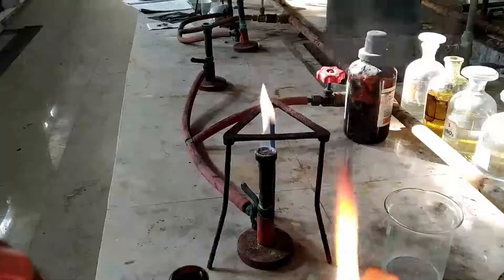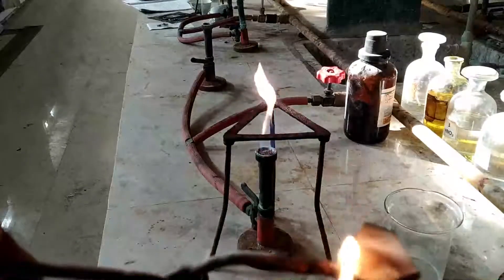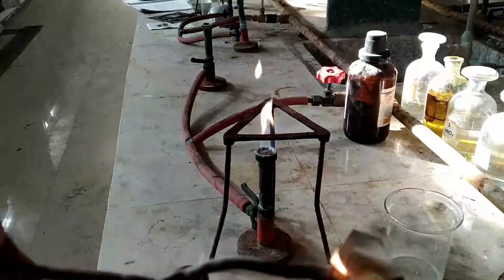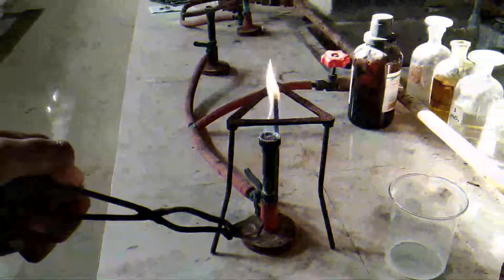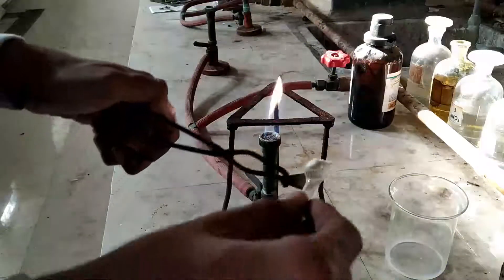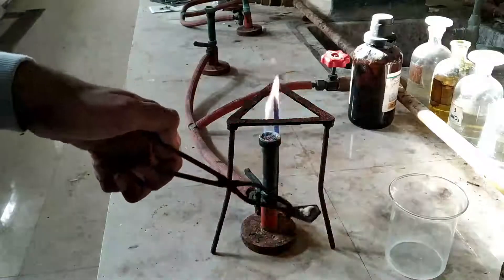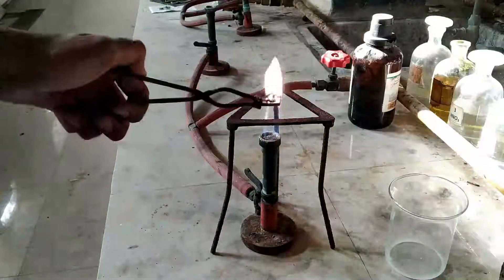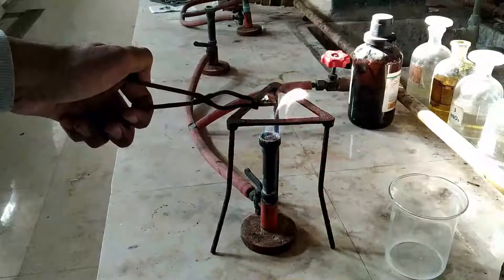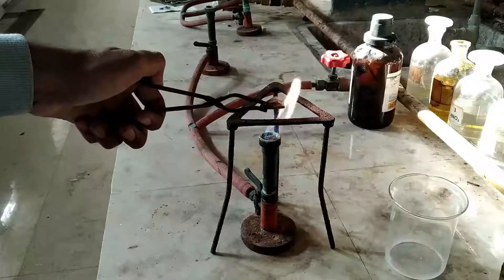Hence it is aromatic in nature. Let us see an example of a solid substance. This is a solid substance — take a pinch of the substance on the porcelain piece and heat it.